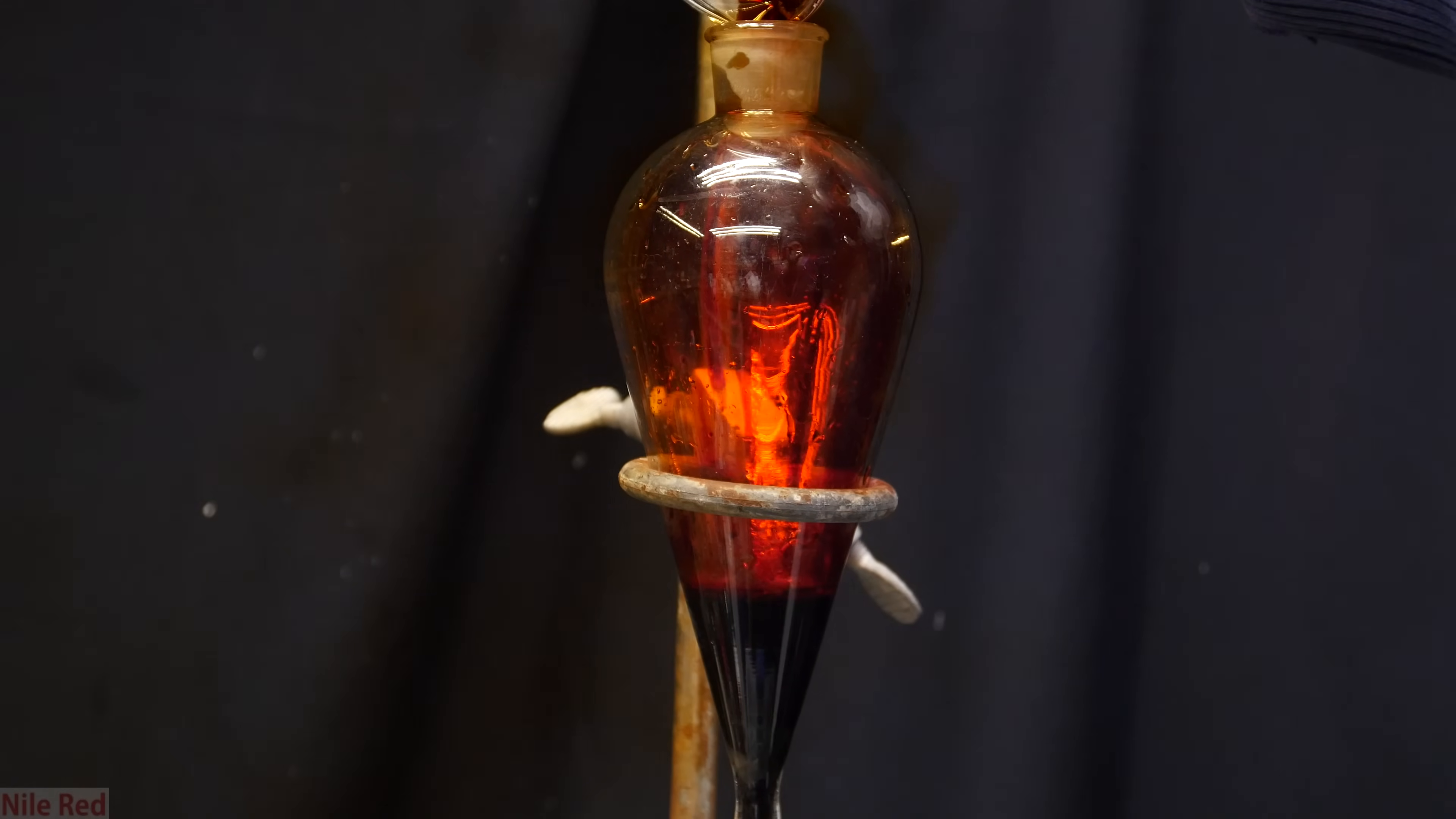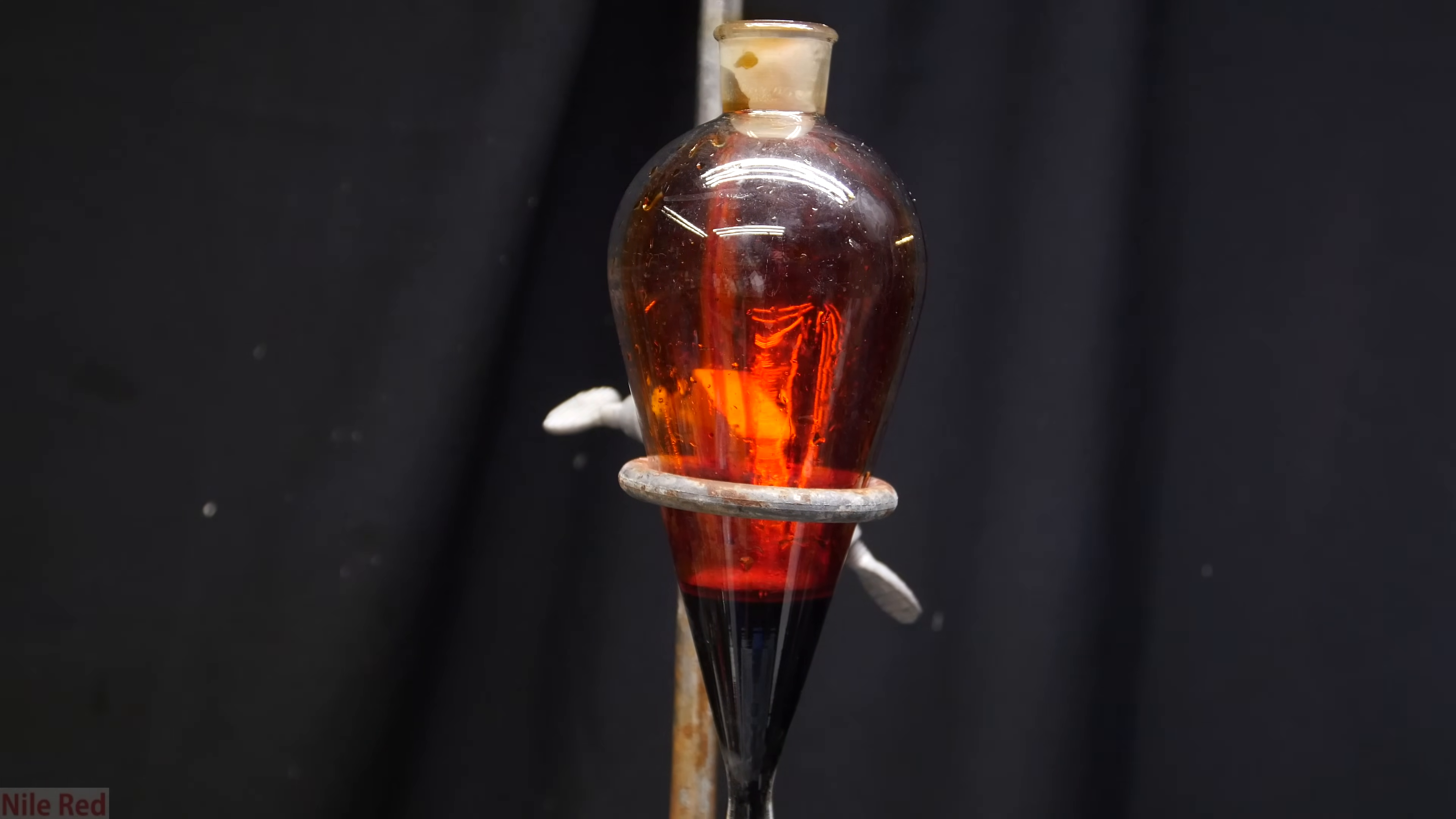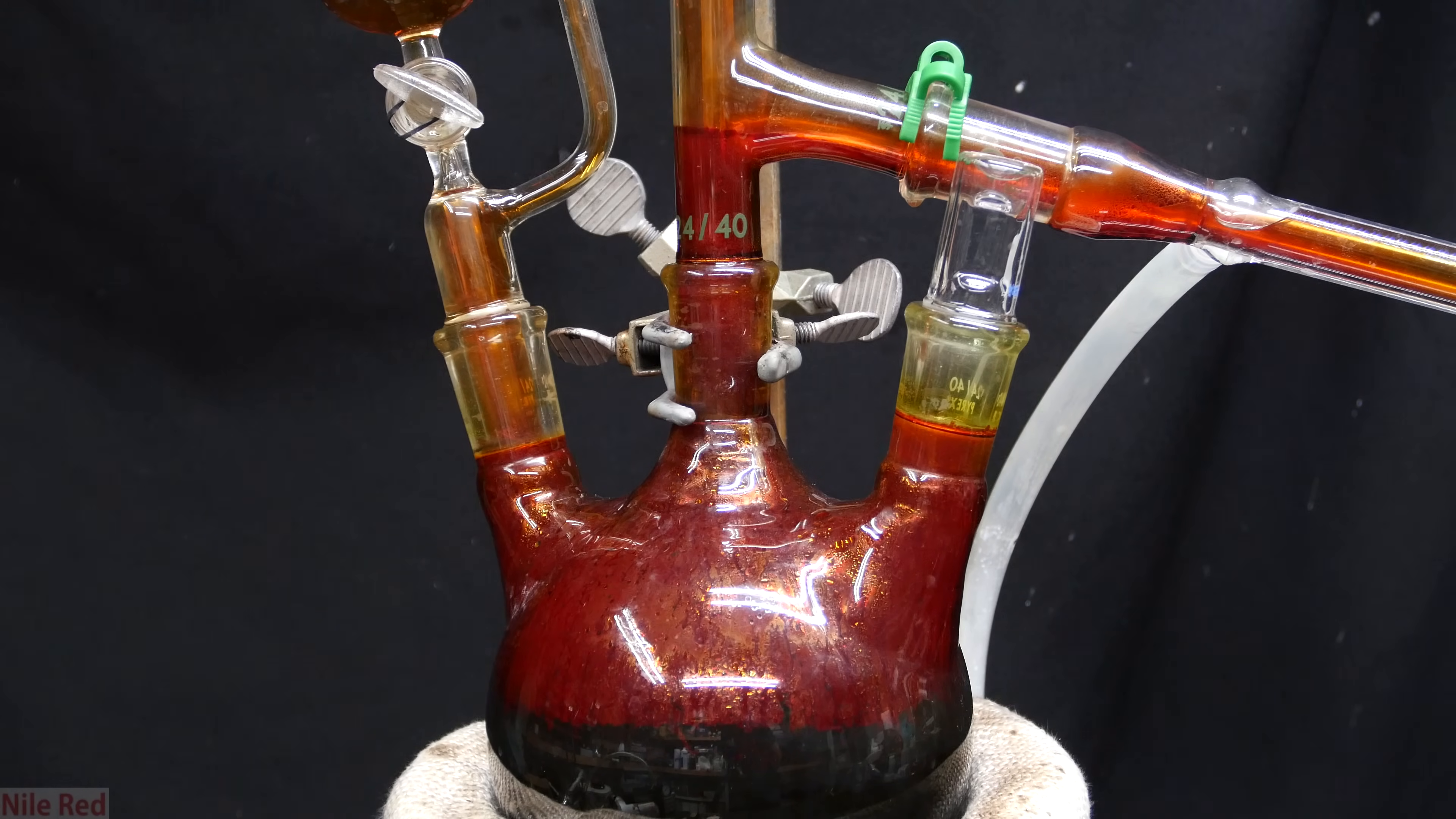With that being said, it is cool, but it's also extremely dangerous, so when working with it, a lot of care has to be taken. I actually made bromine in a previous video, but I want to explore the synthesis again using different chemicals.